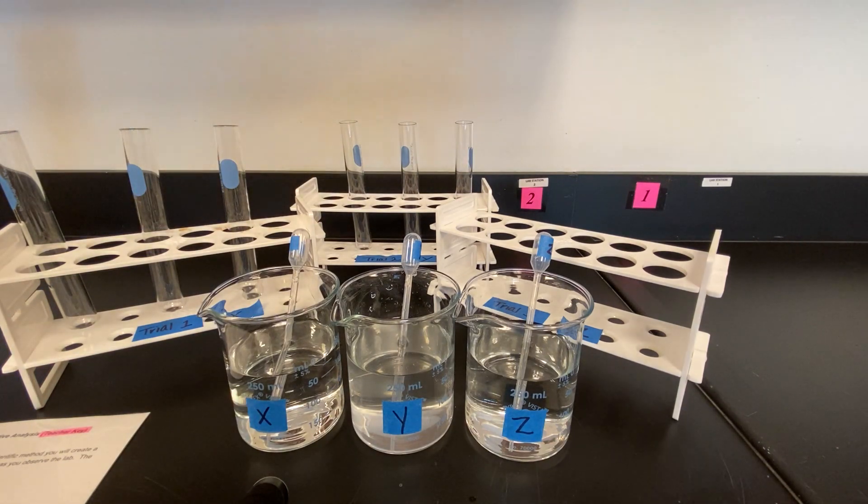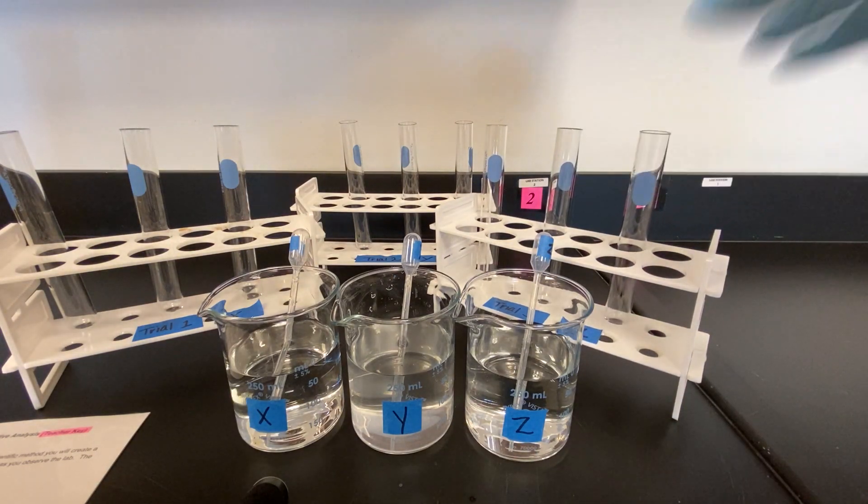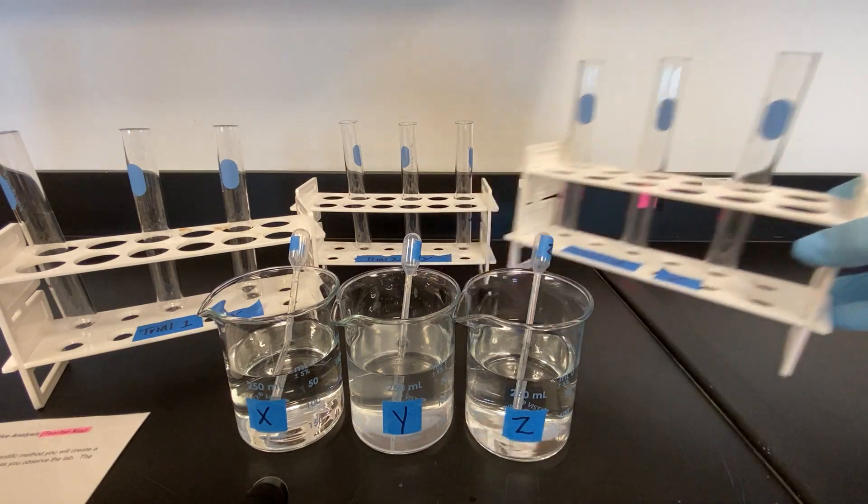And you will need three test tubes for Z, which will be your third trial. So let's begin the first trial.